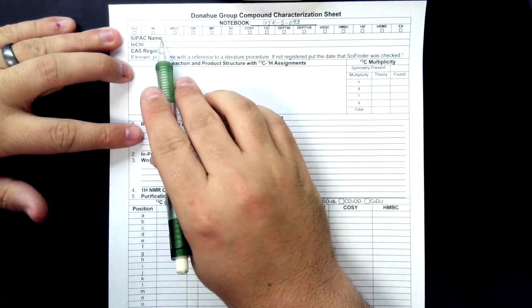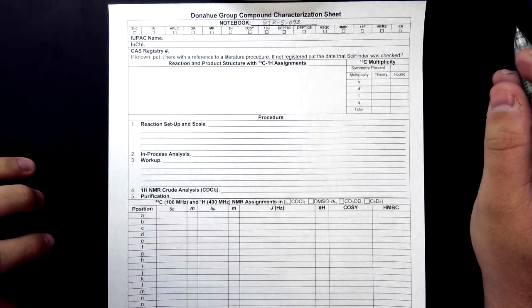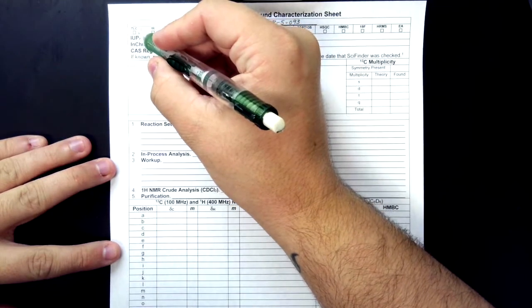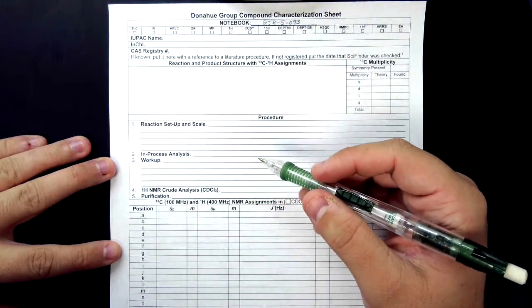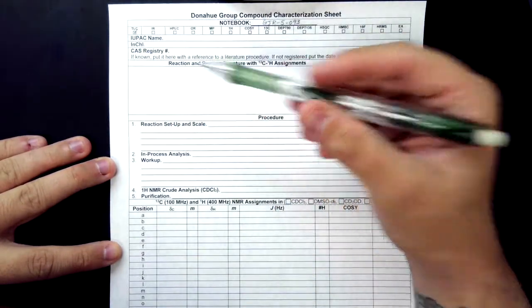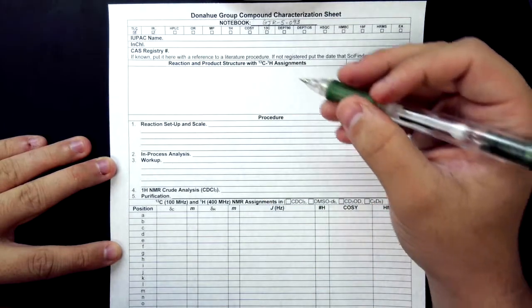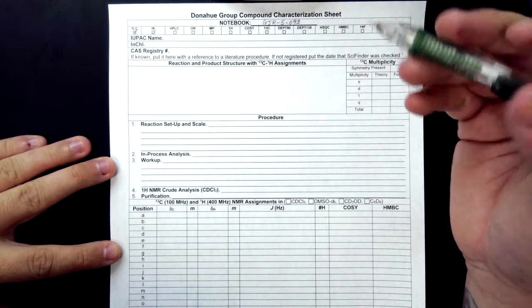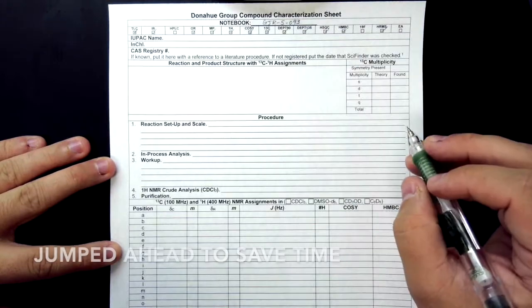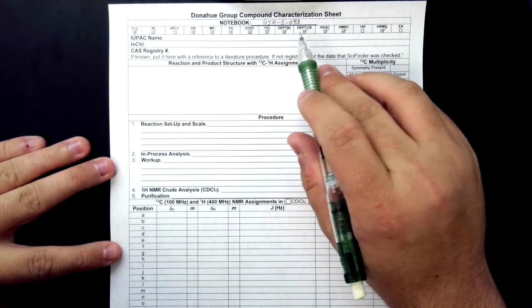Each of these boxes correlates to a different set of data that you can collect for that compound, and you will check each of these boxes that you have. So you can imagine this to say, do you have a TLC already taken? If yes, check the box. Have you taken an IR of this compound? Yes, then check the box. Have you taken an HPLC? I have not taken an HPLC of this, so I will not be checking the HPLC box. There. So all of the boxes that we have data for are now checked.